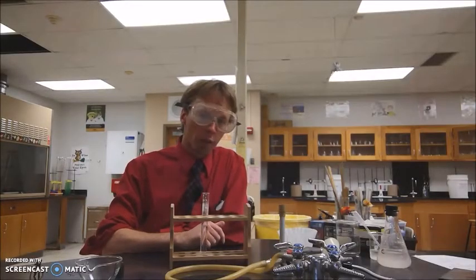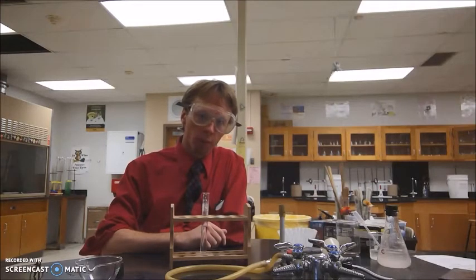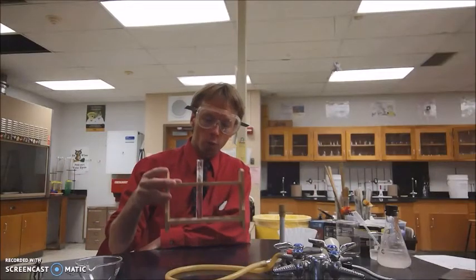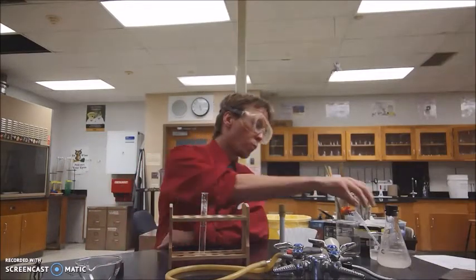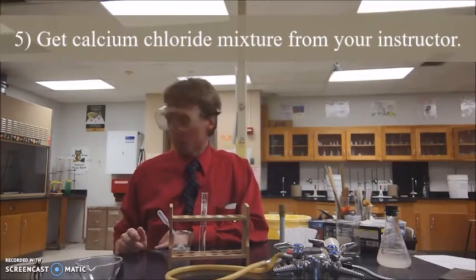For this next part of this lab, we're going to do a chemical change to the mixture of the sodium sulfate and water. What you'll do is you'll take your test tube of sodium sulfate and water, and you're going to get a sample of calcium chloride.